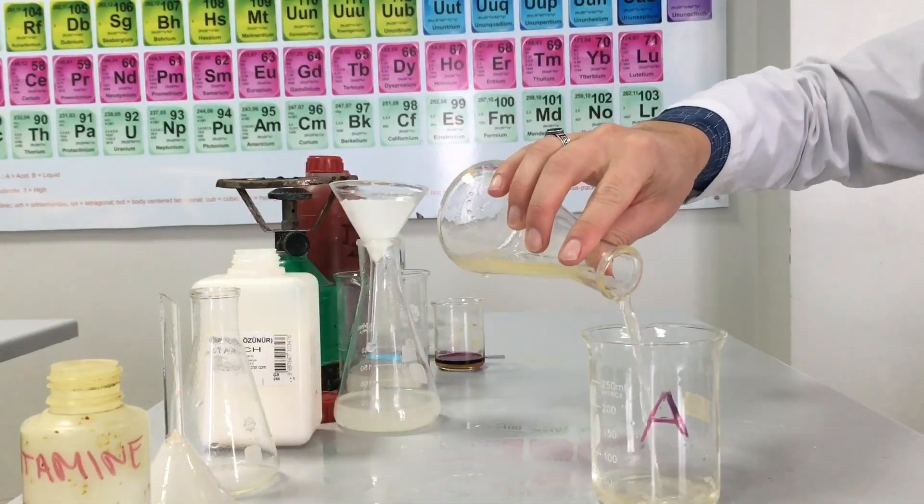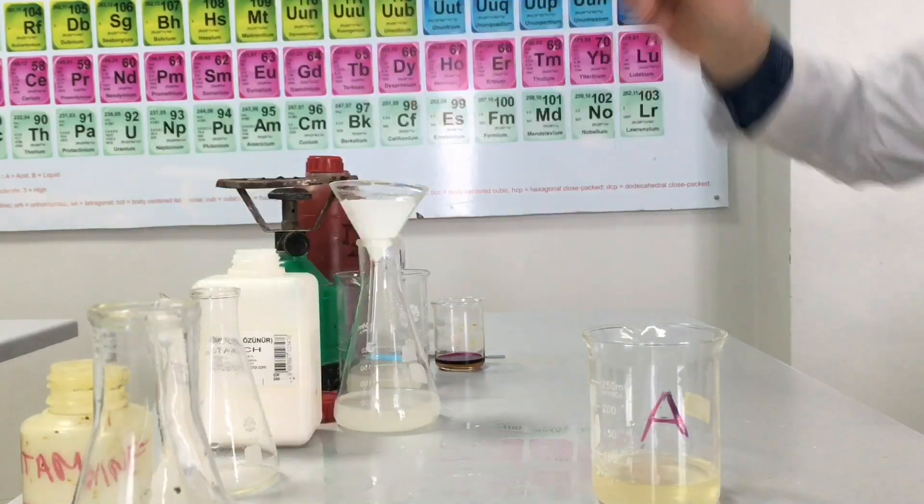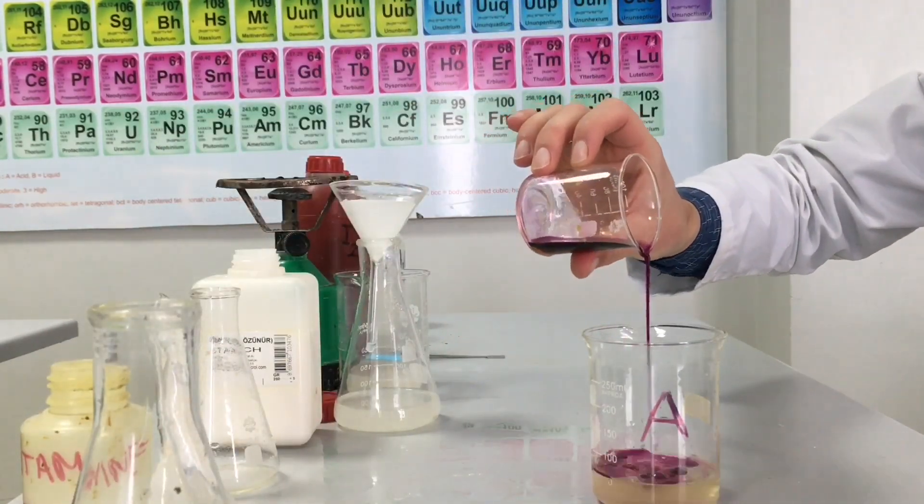And now we are preparing solution A by adding the vitamin C and iodine.